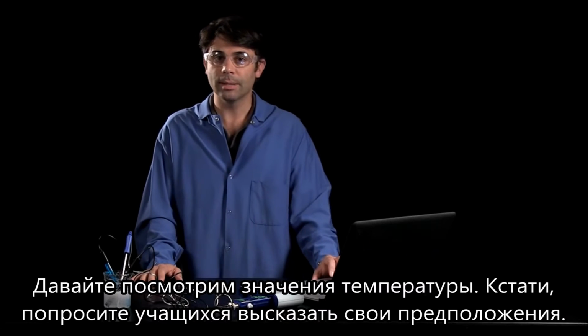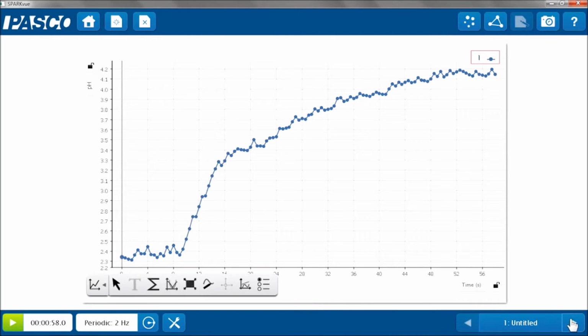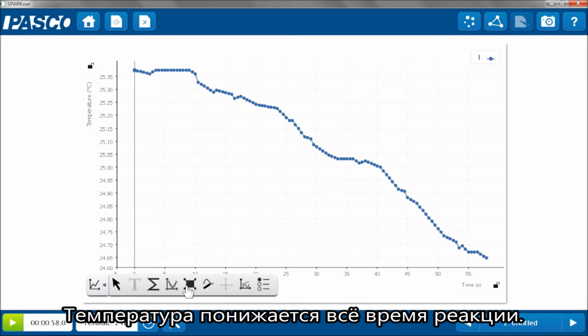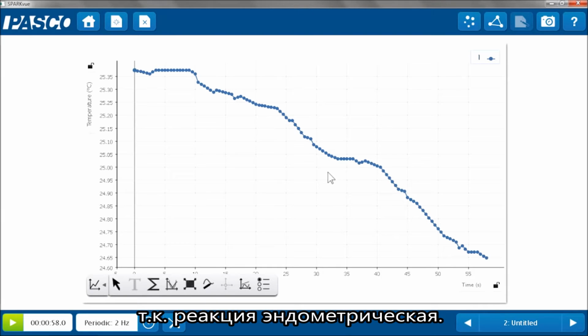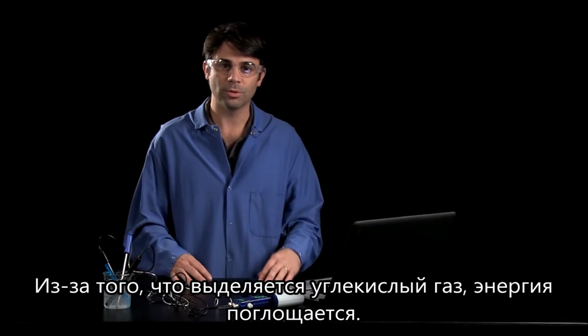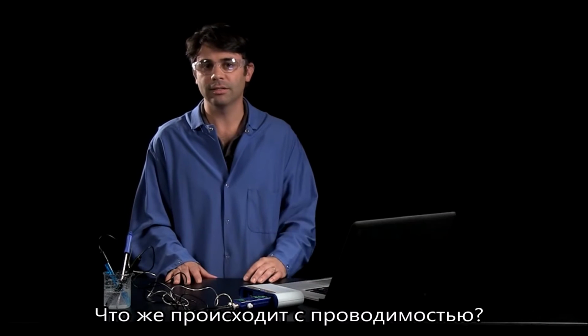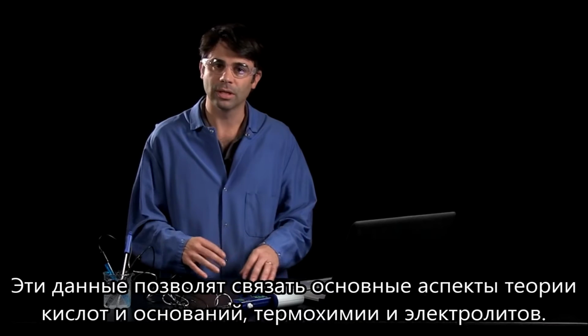And now I'm going to look at the temperature. So again, asking students to predict what happened. And then you can reveal that, after we auto-scale it, the temperature was actually going down the whole time. After I added my Alka-Seltzer, temperature is going down because in this case it's an endothermic reaction. As the CO2 is being produced, energy is being absorbed by the system. So now what's happening to the conductivity? Again, tying in some big concepts of acids and bases, thermochemistry, and electrolytes.